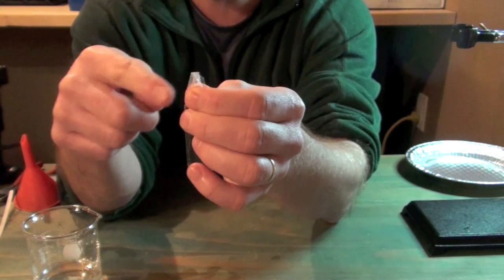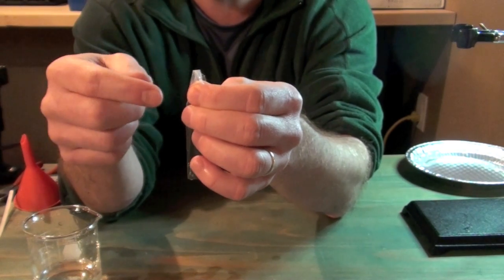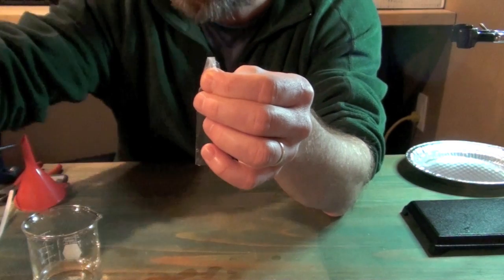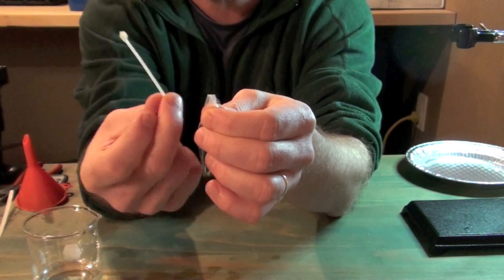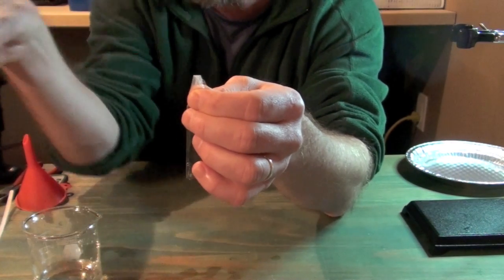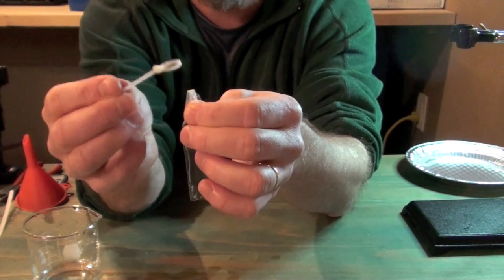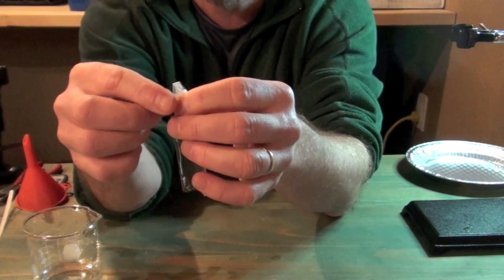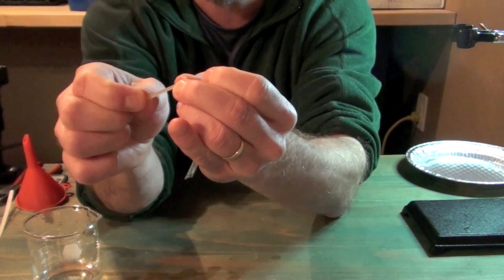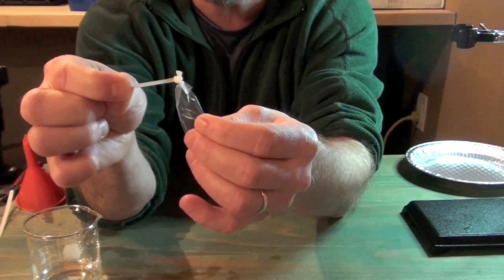Now, we could get our string, and they actually make the little clips too for these dialysis tubing baggies, but what I find is a nice, very cheap, handy solution are these zip ties. And you can get thousands of these zip ties for dirt cheap in different sizes. So what you can do is have your zip tie ready with a small loop on it, and then just put that loop right over your end of your dialysis tubing where it's folded over, and then tighten it like that, and bada bing, bada boom, you've got a really good seal.